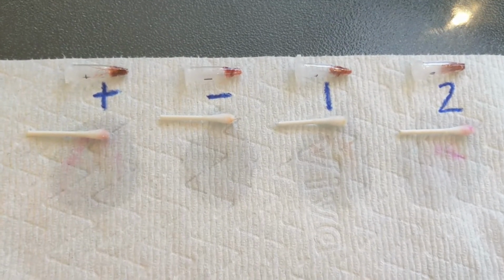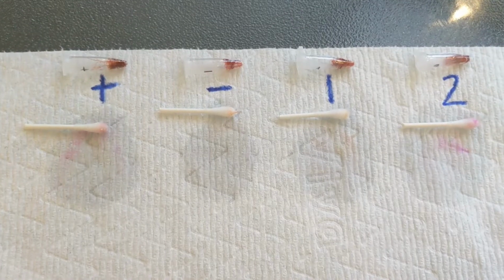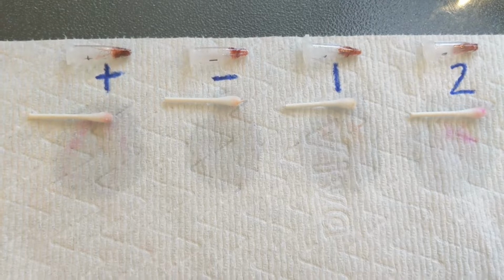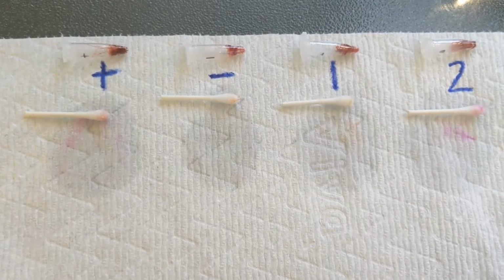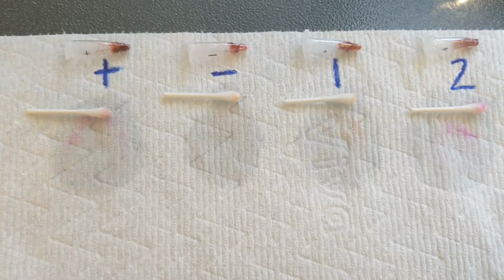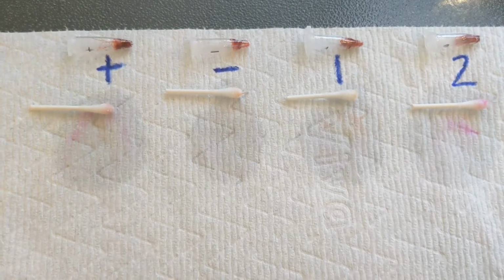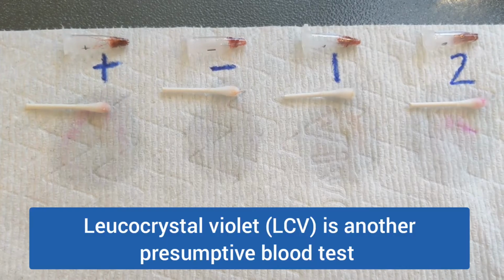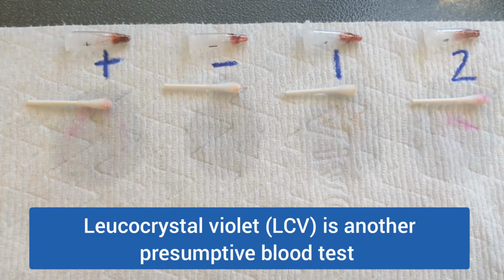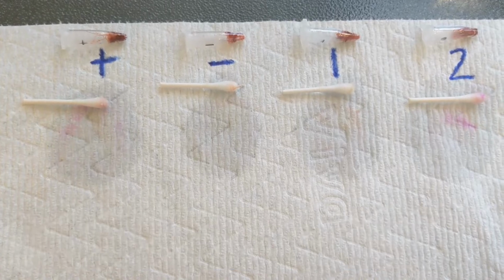There are a couple things to be aware of. First of all, this is the most common presumptive blood test, but it's not the only one. Here you've seen on crime scene shows other blood tests. So there's one called LCV, or Leucocrystal Violet, and that one can be used to check for blood even where it's been cleaned up, like on a carpet, and it's not visible anymore. And they can spray the Leucocrystal Violet solution on it, and it will turn blue.